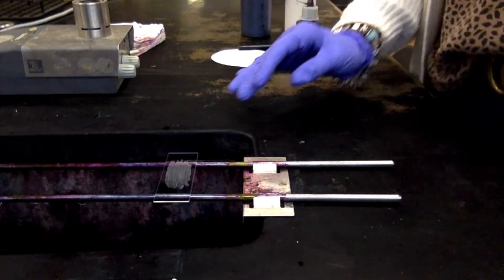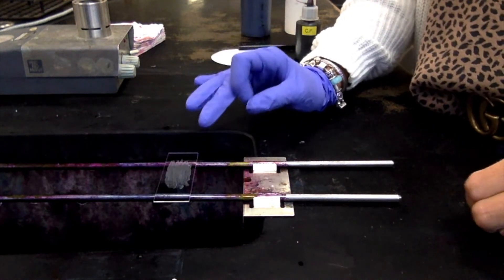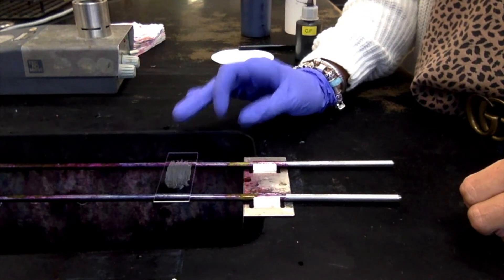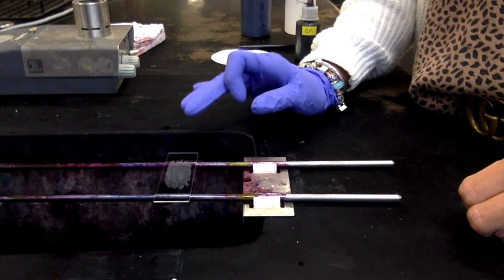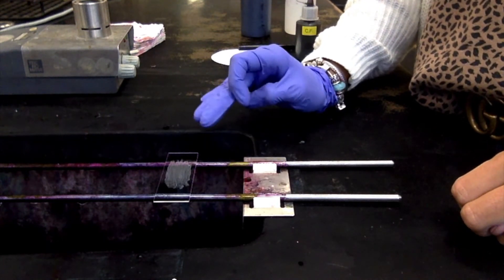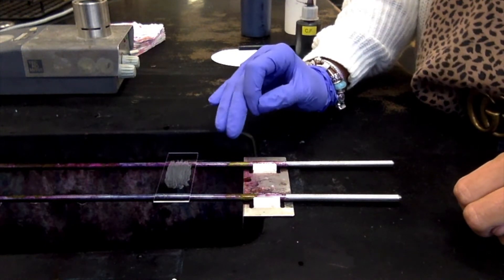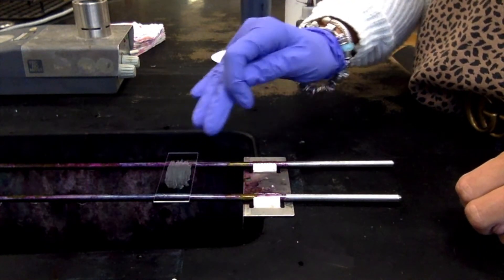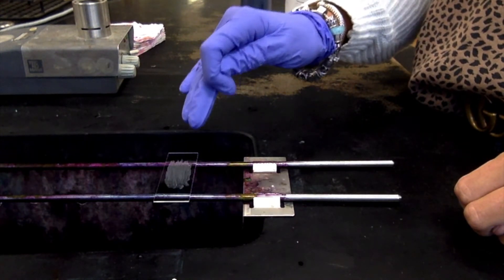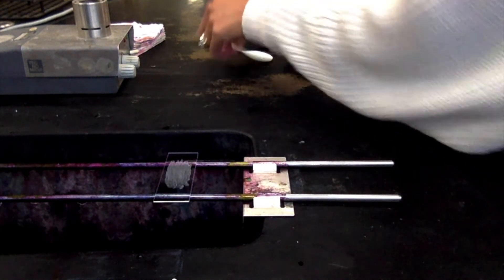I'm here at the workbench to do the acid fast stain. I've got my smear made already — a mixed smear with Mycobacterium smegmatis, which is an acid fast organism, and Staph aureus, which is a non-acid fast organism. So in this smear I should have both acid fast and non-acid fast organisms together so we can see them all at the same time.